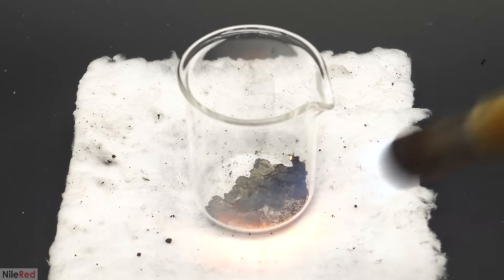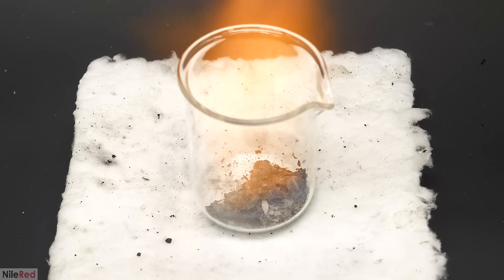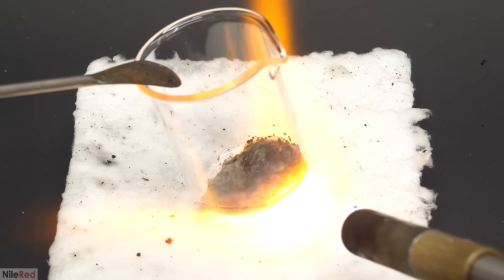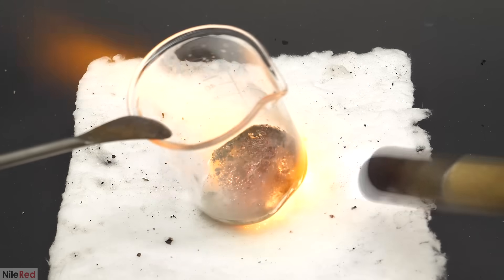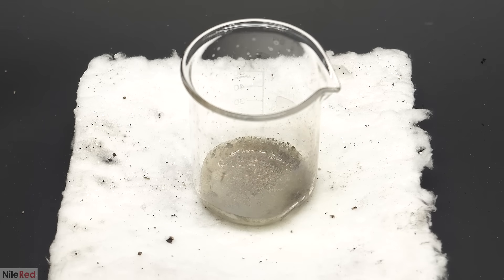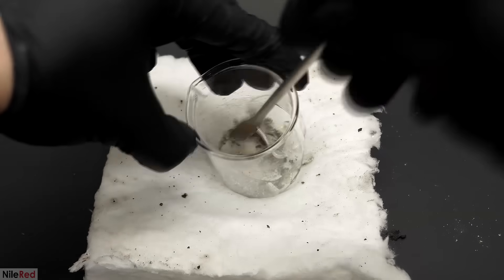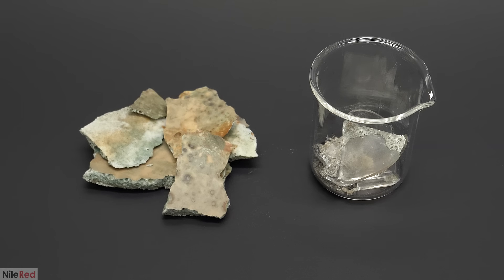I recollected all the ash and the other stuff that got scattered before, and I tried melting it in a beaker. I did this to try to prevent it from flying everywhere again, but it didn't work very well. Unlike before, after it had cooled, it didn't just easily separate. To try to get it out, I poked and scraped at it, but I ended up just giving up and breaking the bottom out.